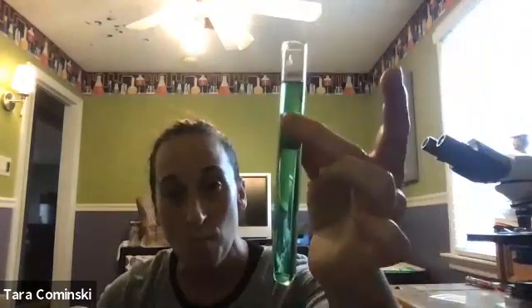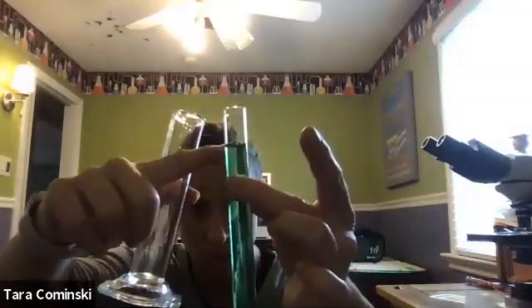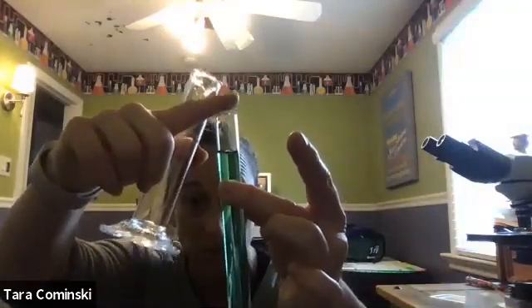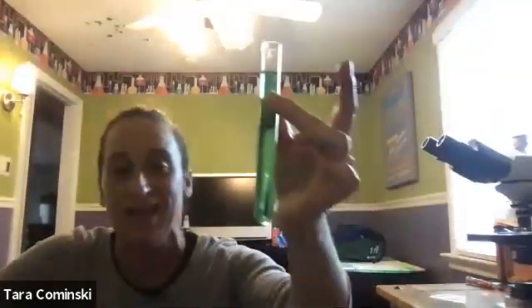So the question says determine, right? Come up with a hypothesis how you would figure out how much total this test tube holds. Meaning it's showing you 20 milliliters right now. How would you determine what the volume would be if I fill this all the way up? I'm not going to tell you. Figure it out. There's a very simple answer to this. Sometimes we come up with all these complex answers. It's not that complex. Just try to be simple about it.